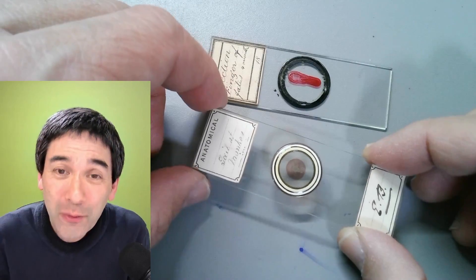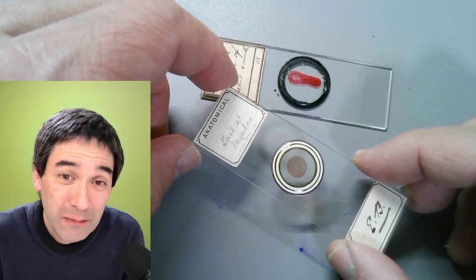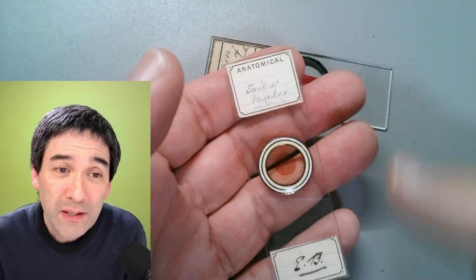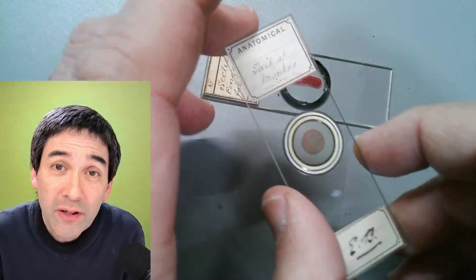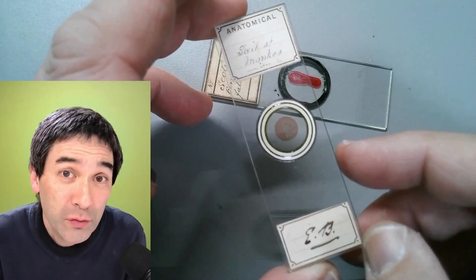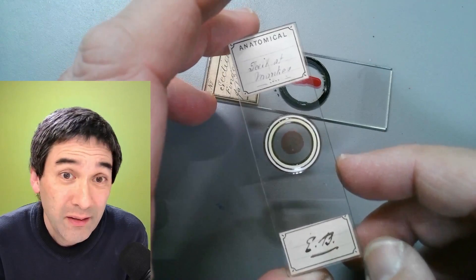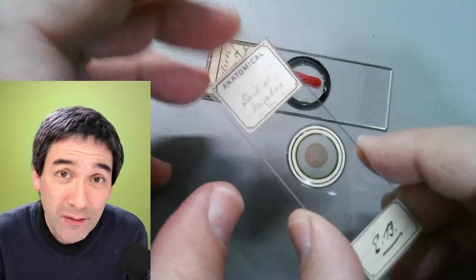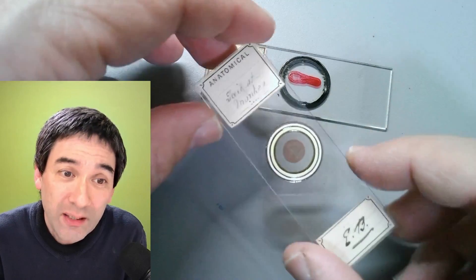I hope that you're not going to do that. I do understand why some people consider them a little bit problematic. This one over here, for example — it says 'the tail of a monkey.' So this is the cross-section of the tail of a monkey. The slides are antique slides, approximately over 100 years old. I bought them online and they were quite expensive — these are high-quality slides and we're going to have a quick look at them under the microscope in just a second.